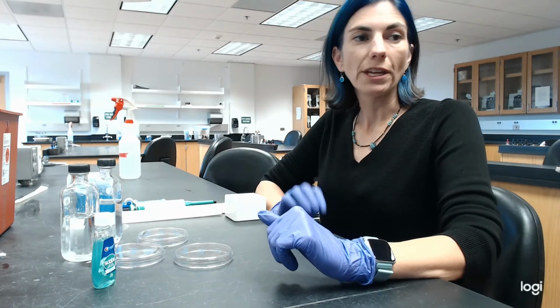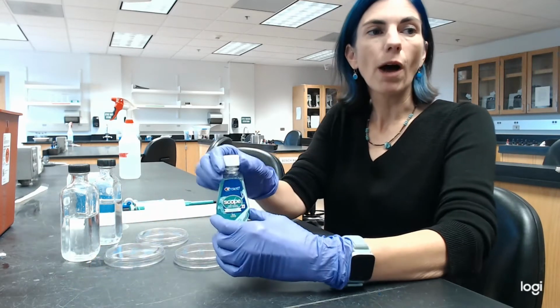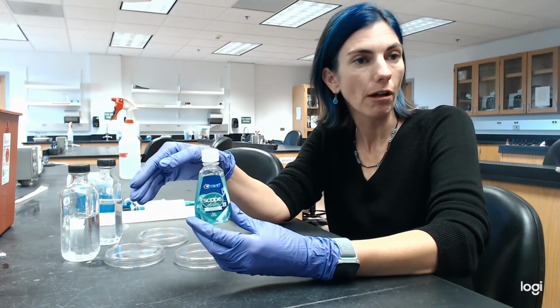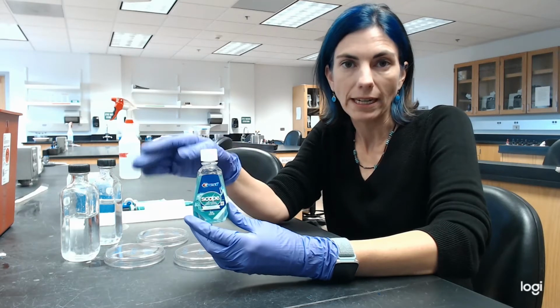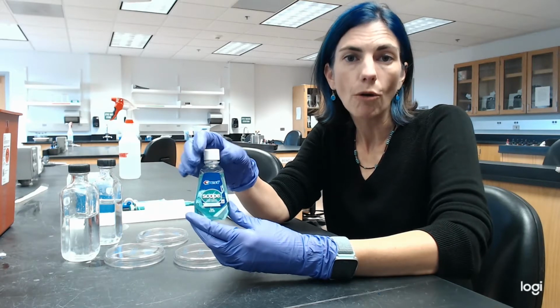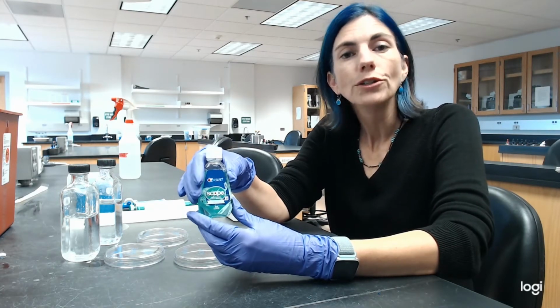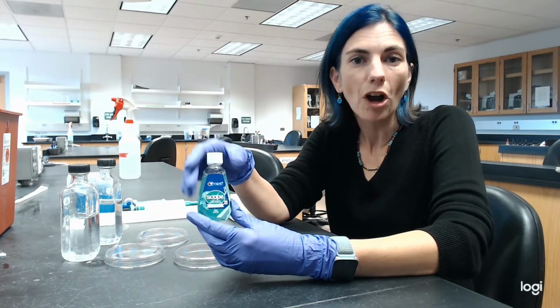Now what's different about this particular adaptation to the serial dilutions is that I expect that this mouthwash will actually kill off a lot of the microbes in my mouth. So therefore, if I follow standard Lab 8 protocol and do serial dilutions to the 10 to the minus 4, 10 to the minus 5, 10 to the minus 6, and 10 to the minus 7, I expect to get almost no colonies, certainly nothing within 30 to 300 colonies, which is what a countable plate is. So therefore, I'm going to scale my serial dilutions down and make them more concentrated.